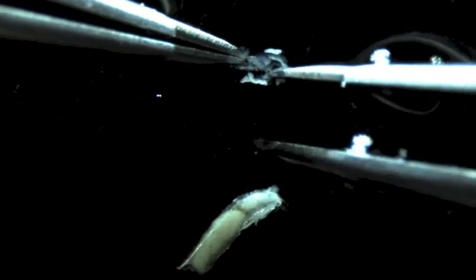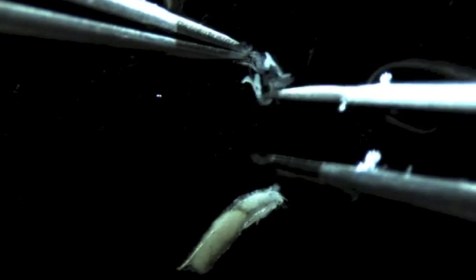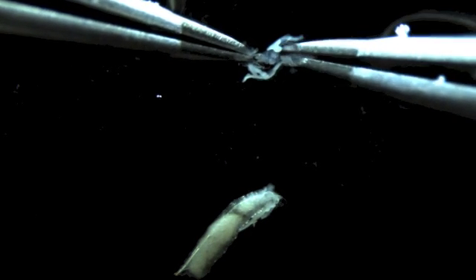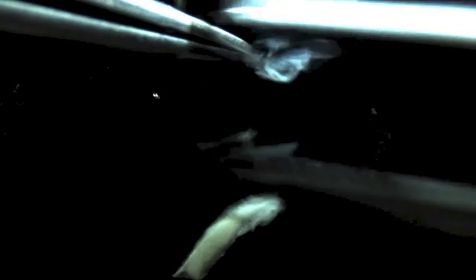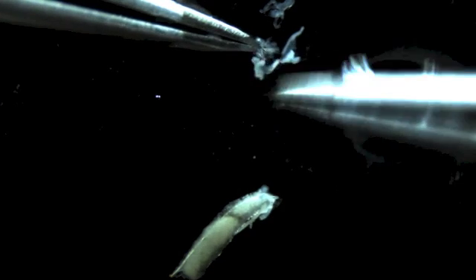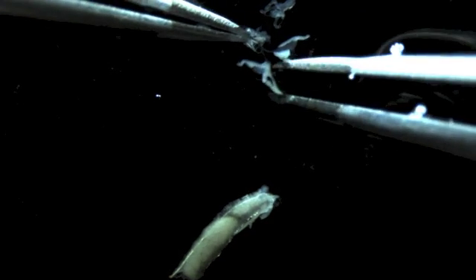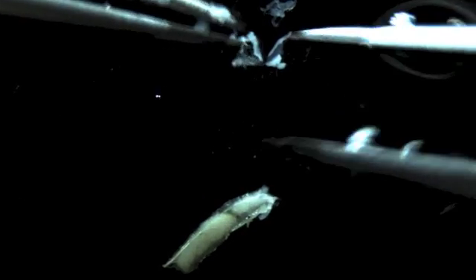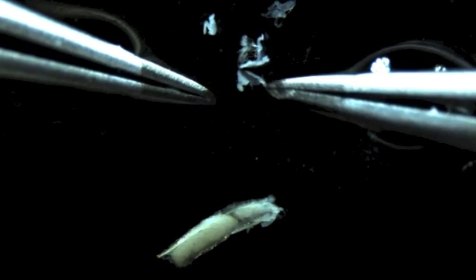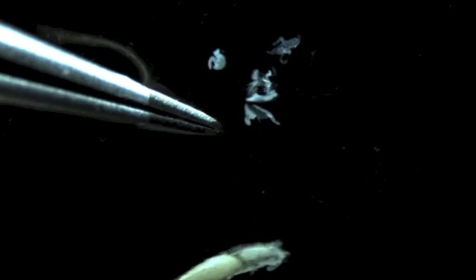In this dissection most things came out quite cleanly, so we won't need to clean it up very much. Moving up to high magnification here — I just want to point out that we like to keep the head cuticle and the mouth hooks attached to the salivary glands. This helps with the immuno, weighing down the sample in our net wells; otherwise they tend to float up out of the net wells, which can be frustrating when you're trying to do the immunofluorescent staining.